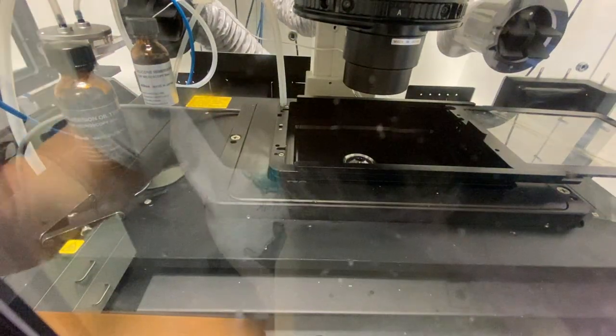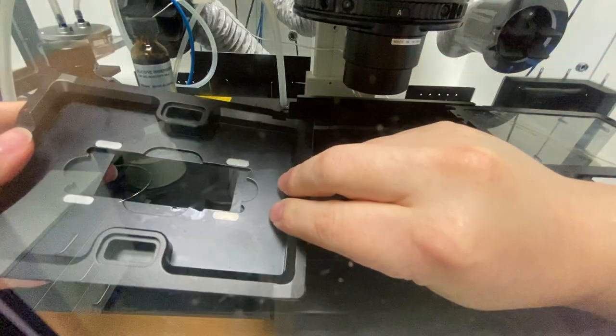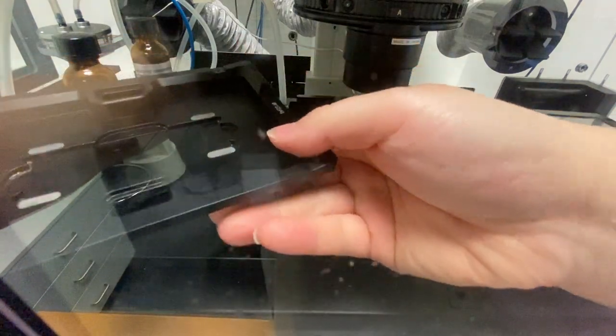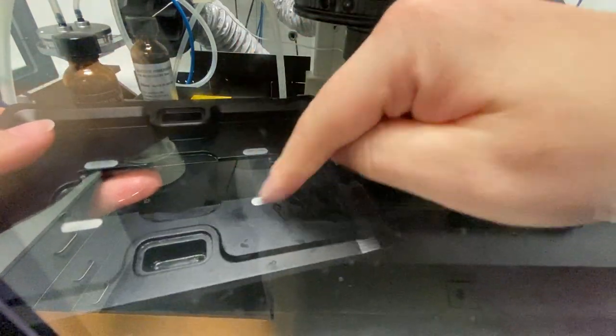Now the last person may have left this stage insert in, which is okay. But just make sure they haven't left their sample on.